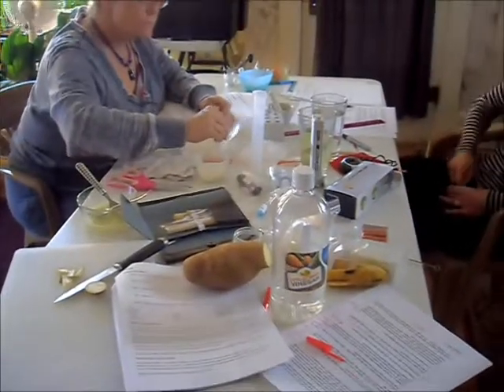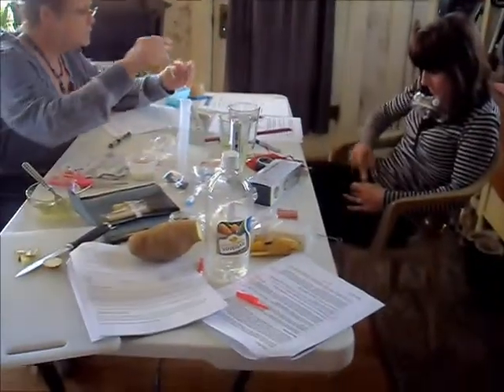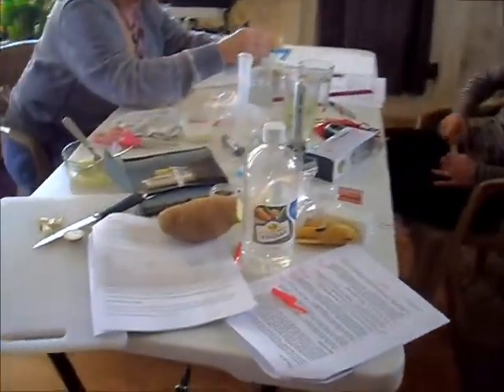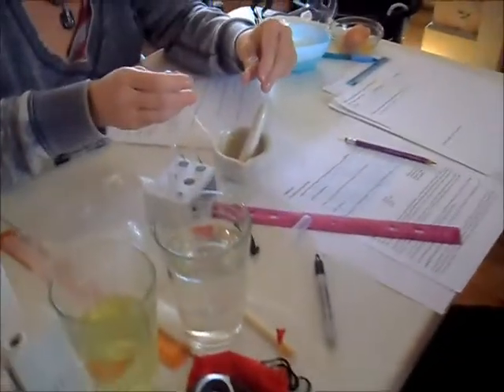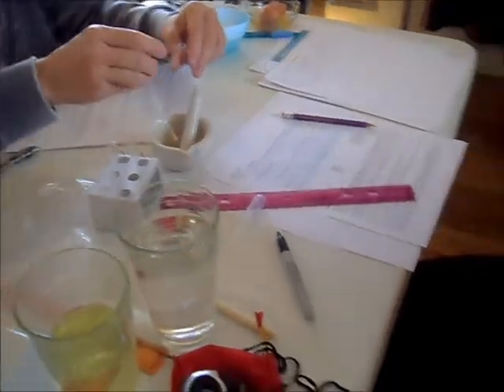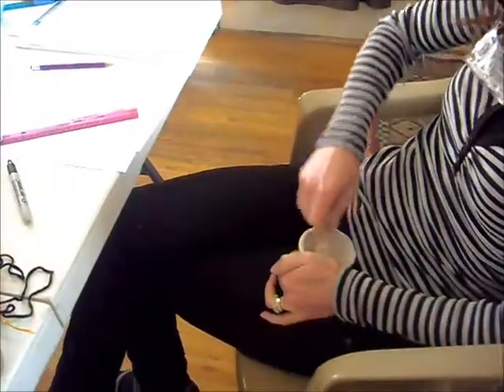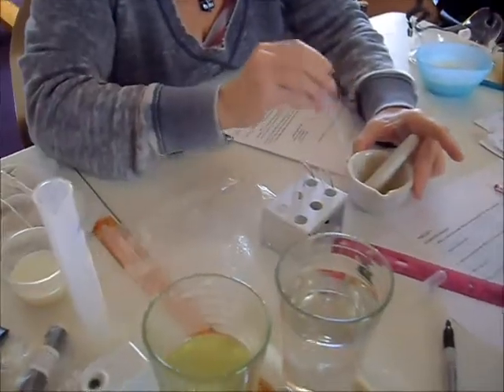Melanie and Cindy finished the protein test by taking notes and discussing the reaction they saw in the test tube. Now they're working on the sugar test. They're making a mash of banana, onion, and potato, and they'll set up the test tubes again and watch a similar reaction come up.